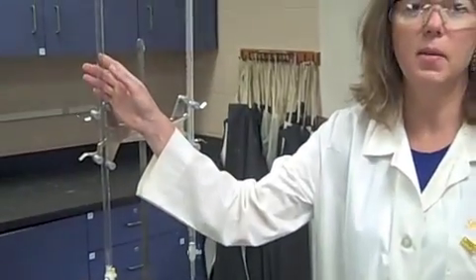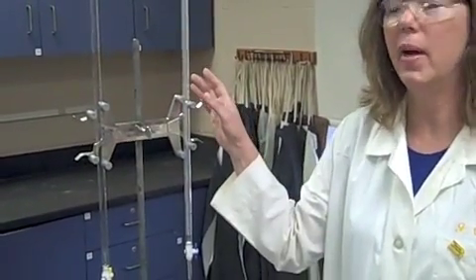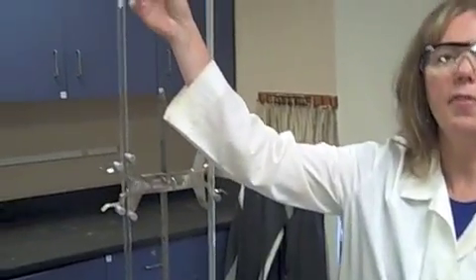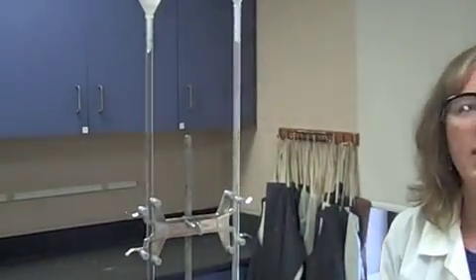So I always put the acid burette on the left and the base burette on the right. You'll need a funnel for each one of these, a ring stand and a burette clamp.